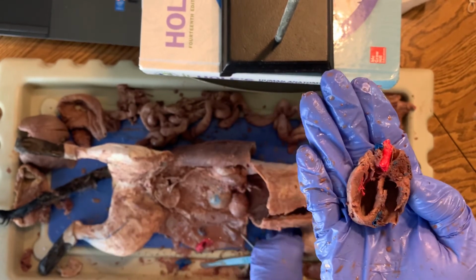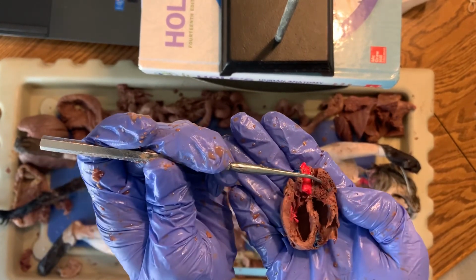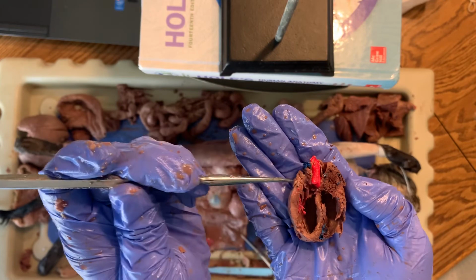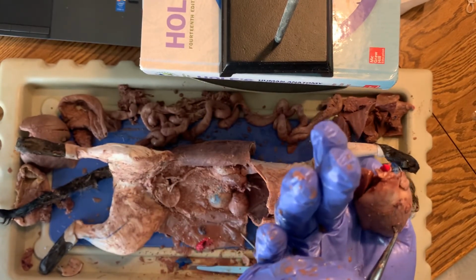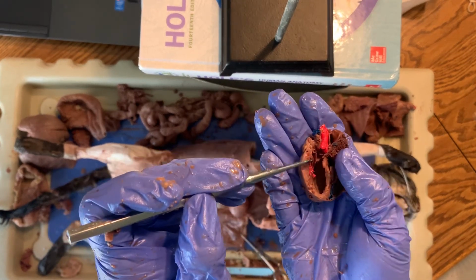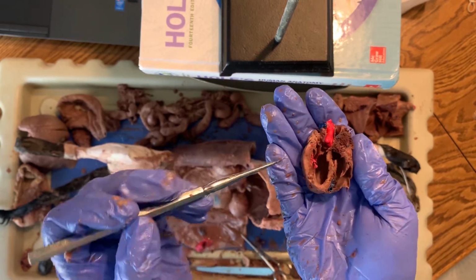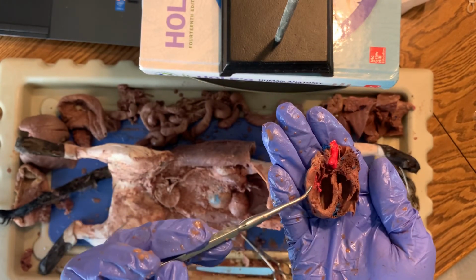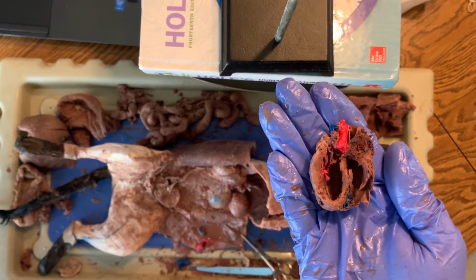And so the atria are up here. This one is still filled in with stuff right there. So the valve would have been right there. This one here, I keep forgetting because it's opposite for me now. Left atria is up here, separated by a valve. Hard to tell, because again, I ripped a lot of that stuff out. But definitely a difference in thickness of the wall of the muscle, because it has to go a whole heck of a lot farther for the cat and for us.